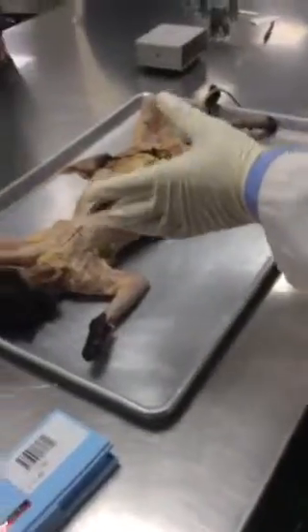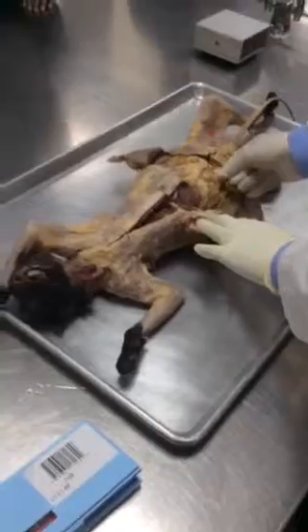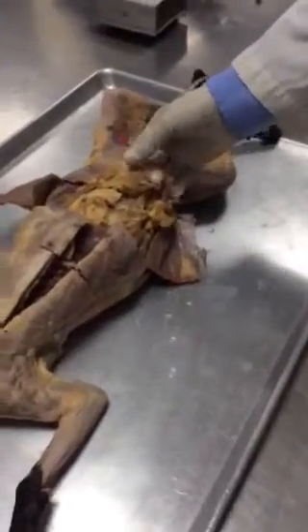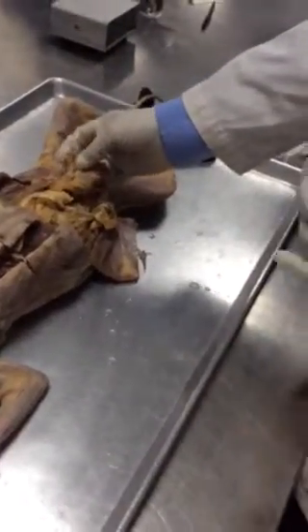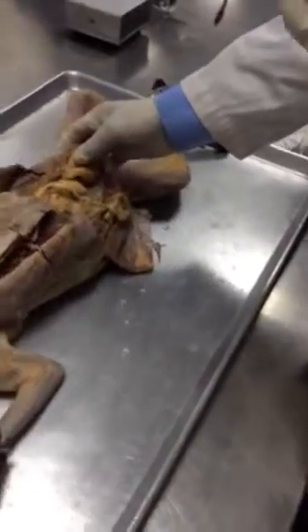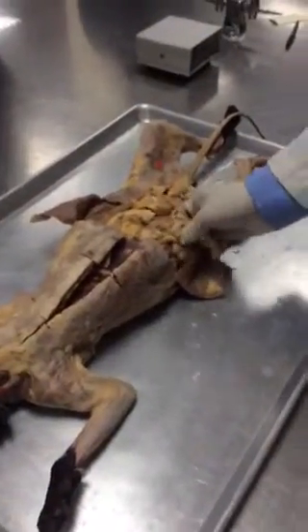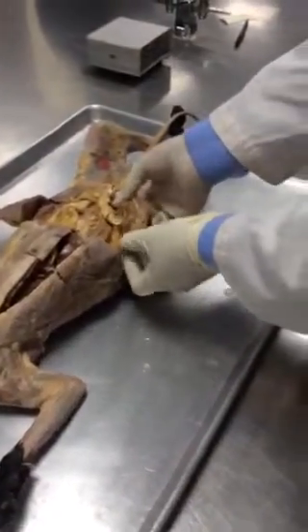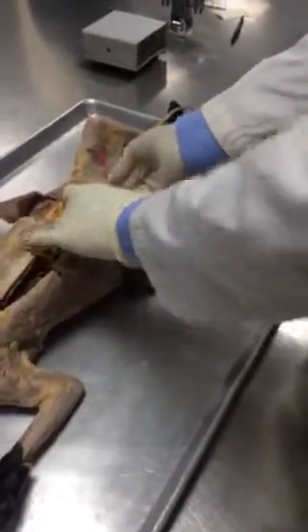I asked you not to move anything, not to remove anything, and you didn't. Thanks for that. And here you see the thing. This is the pad of fat, right? So, what do you call it? This pad? This is not the intestine, right? So, what do we call it? Yes, greater omentum, right? This is the greater omentum. And you see how it is covering the intestine, right? Like a wrap, all right?